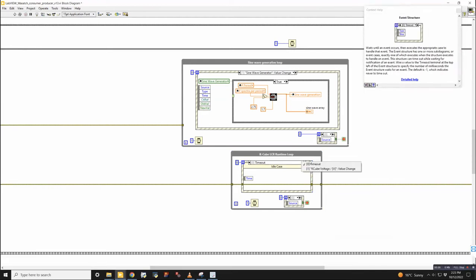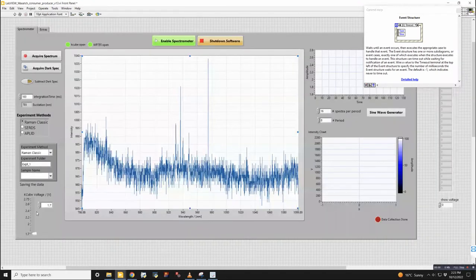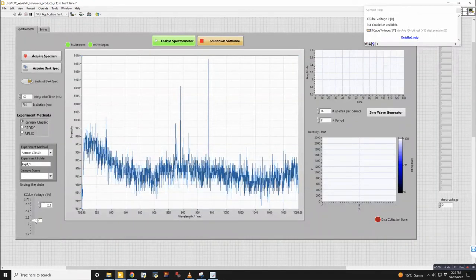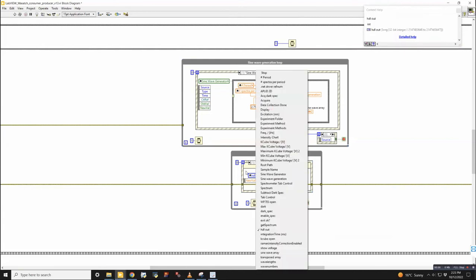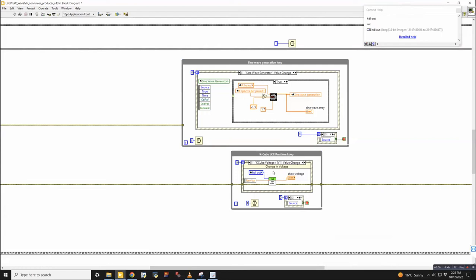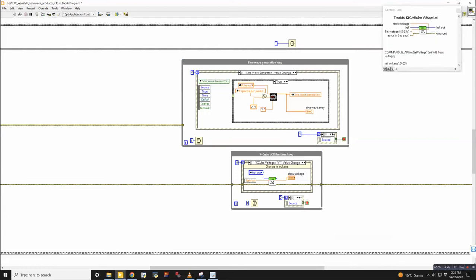So there is one case where this will do something. It is an event that happens based on the K cube voltage, which is this slider bar over here. What that loop is doing is waiting for some change in value here. When it finds that there is a change in that value, it takes that new value and inputs it into the set voltage sub VI. So this will set the new value to the K cube.